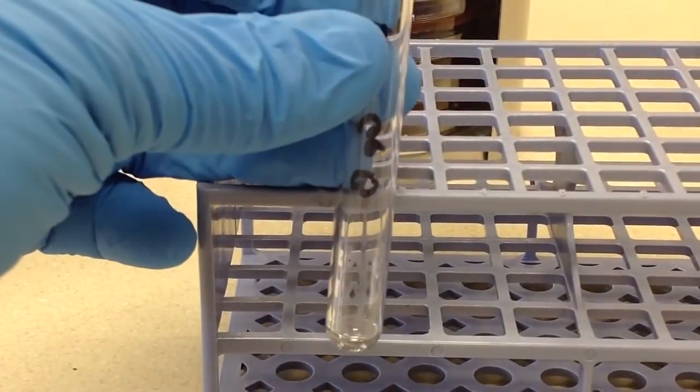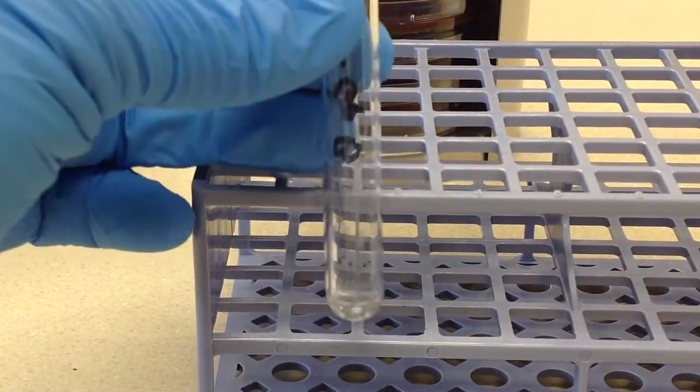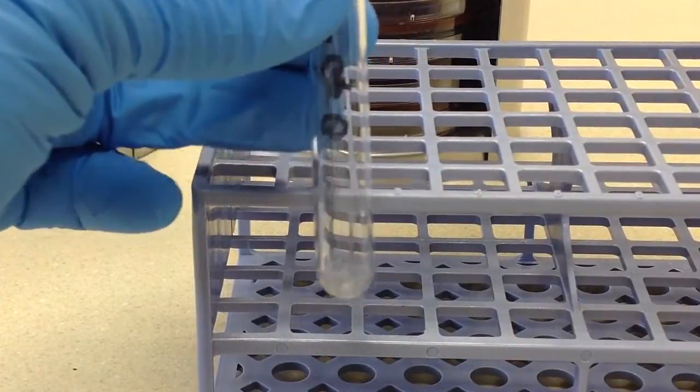I'm going to get that in there and get that emulsified.